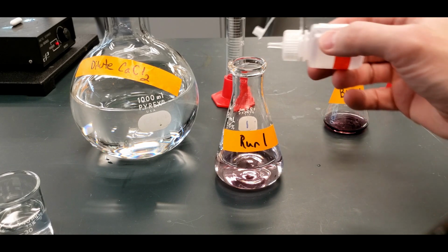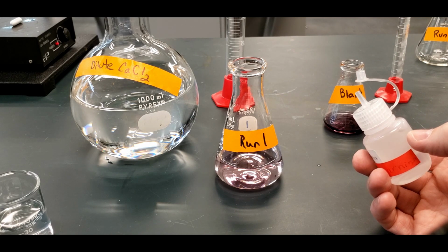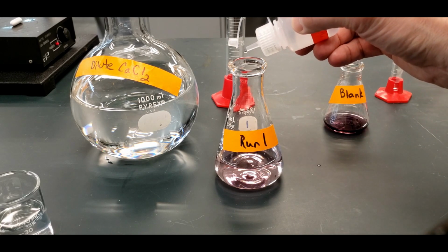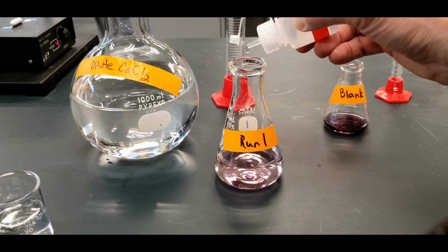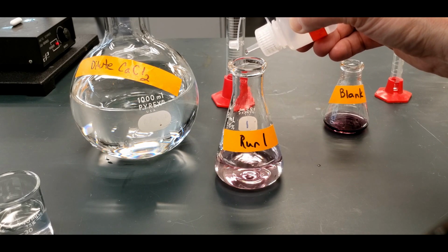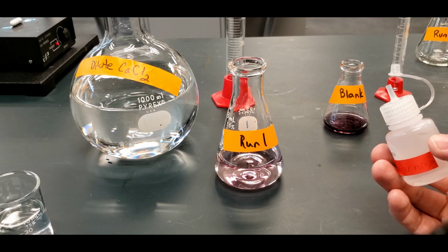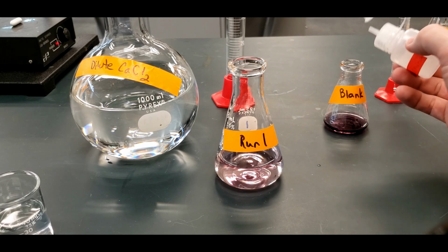So we have, make sure I'm getting that right, because a lot of things in this one. So 1, 2, 3, 4, 5, 6, 7, 9, 10, 11, 14, 15. And then same thing in here.